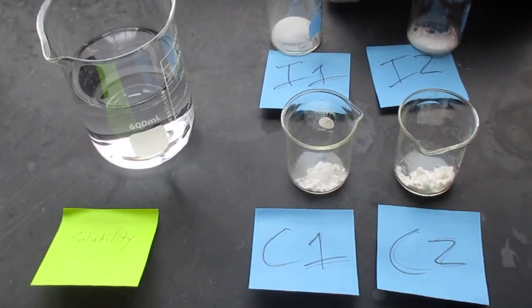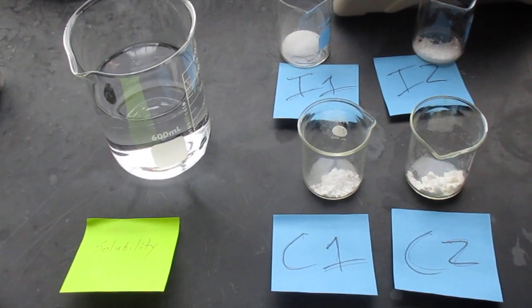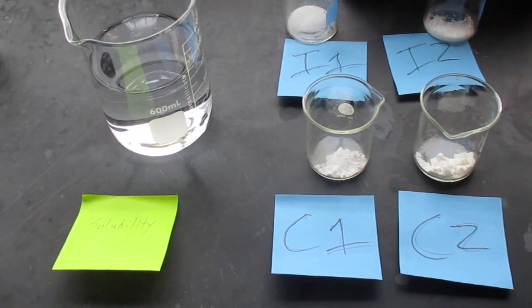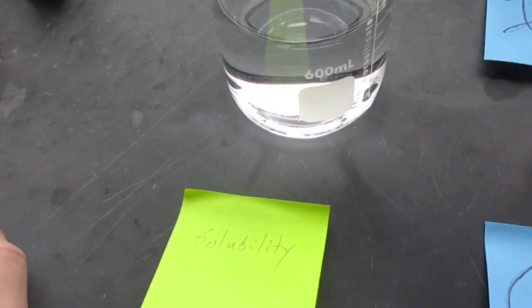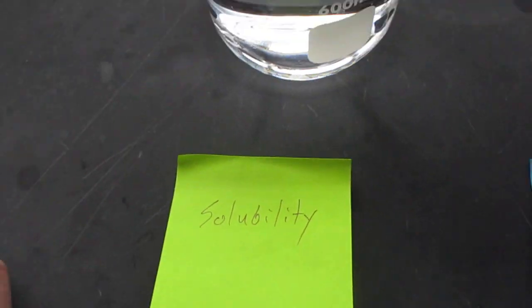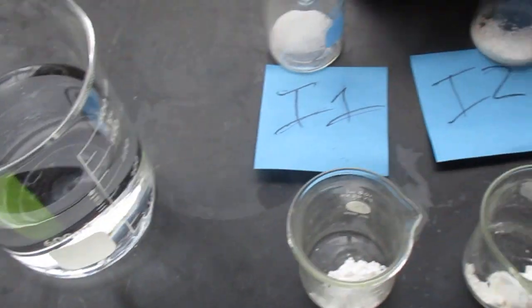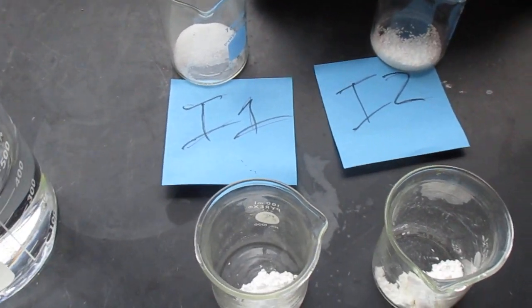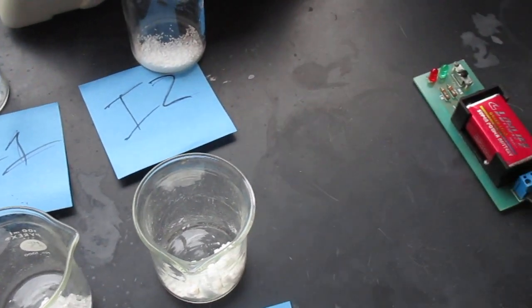So the next test is the solubility test, and all that says really is does it dissolve in water. I have some DI water here as we work on solubility. What I'm going to do is I'm just going to see does it dissolve in water, so I'm just going to add a little bit to each one of these and see how it goes.